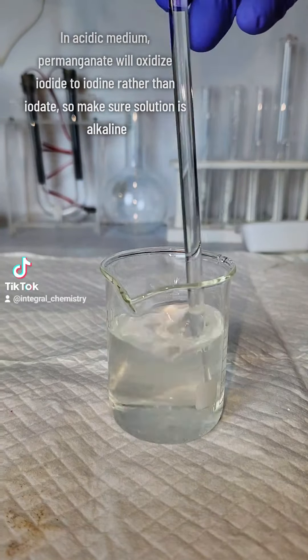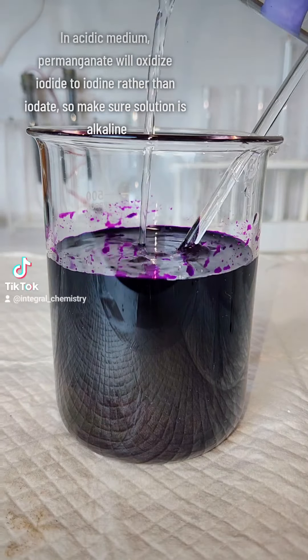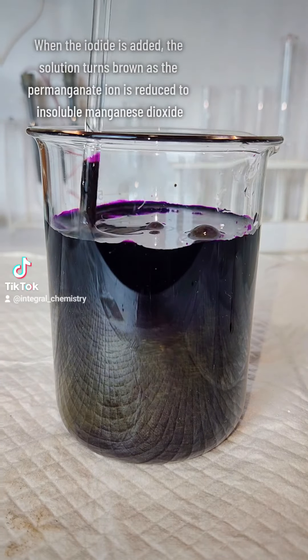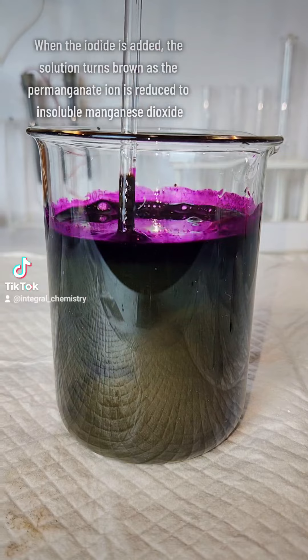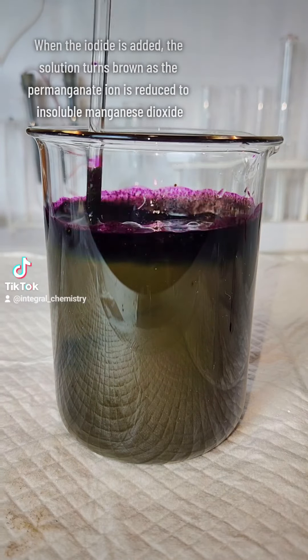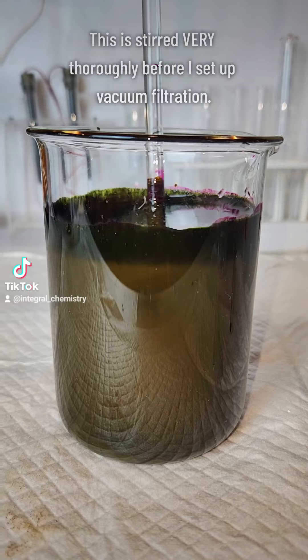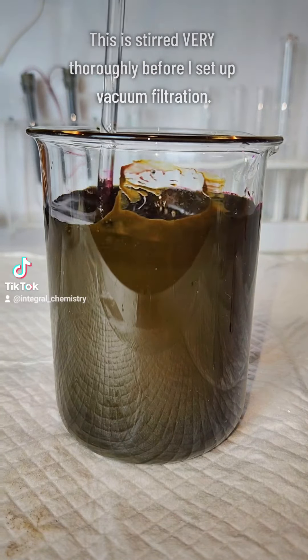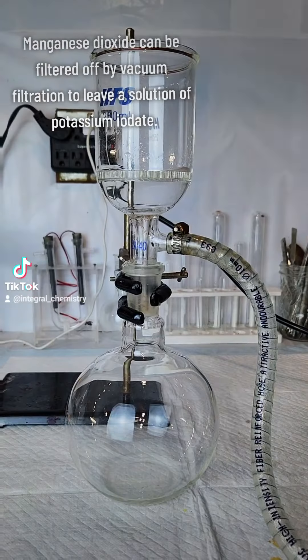Since it requires two molecules of permanganate to oxidize one molecule of iodide, I dissolve about an eighth of a mole of potassium iodide in some water and then pour it into the permanganate solution. You can see here that when the potassium iodide is added, the solution turns a dark brown as the potassium permanganate is reduced to manganese dioxide.